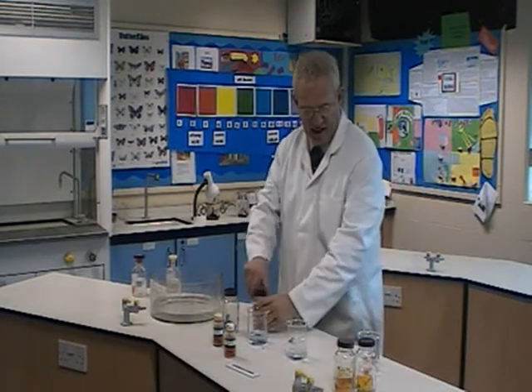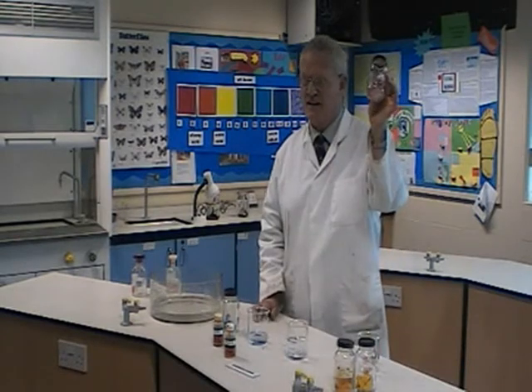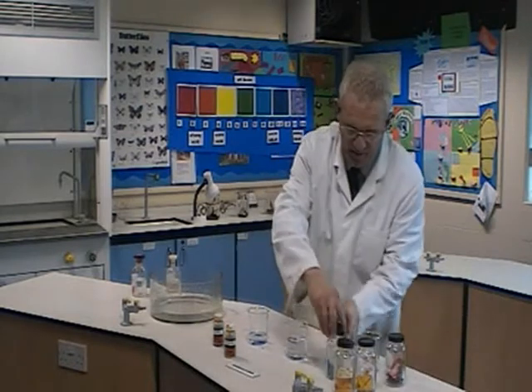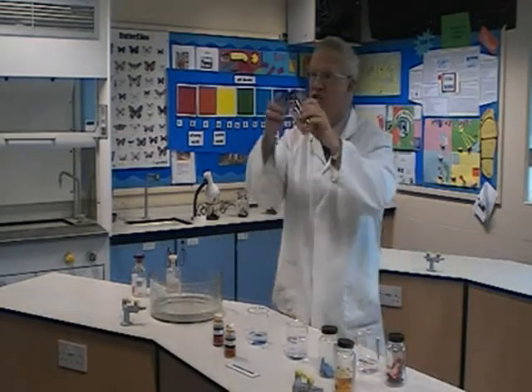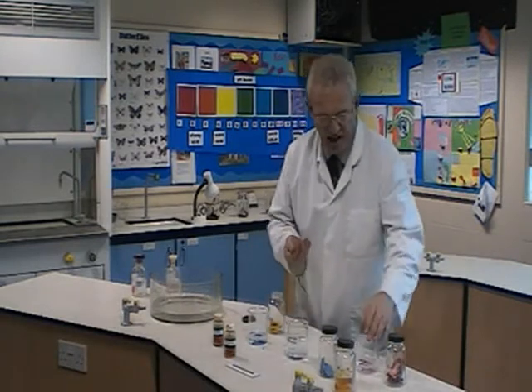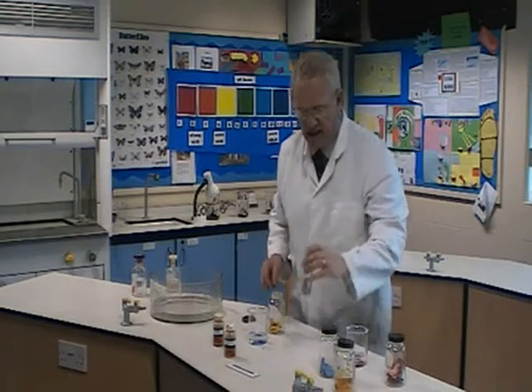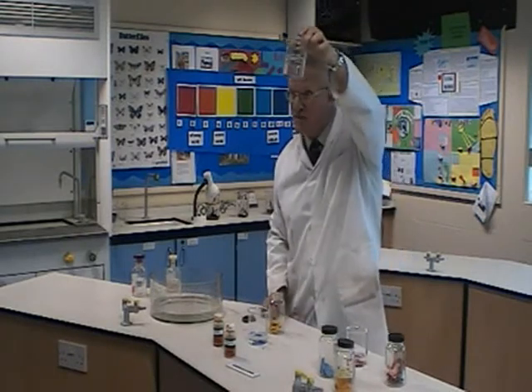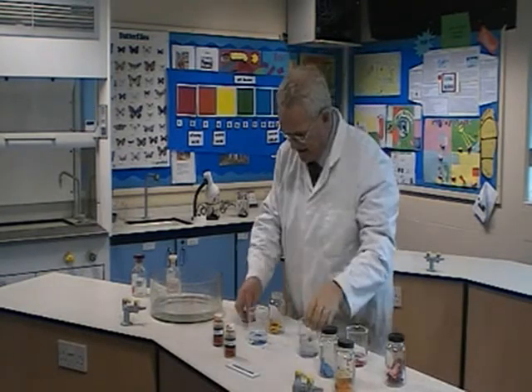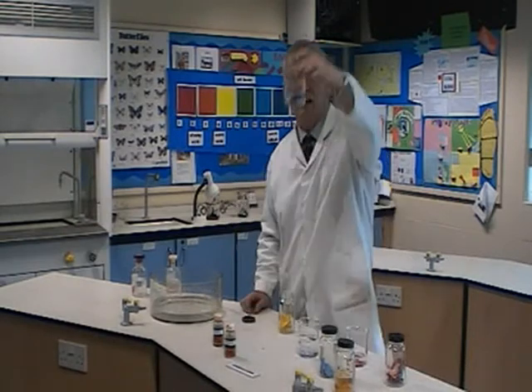A little rhyme coming up — but let's just refer to these as indicators. Although that's litmus paper, let's just refer to indicator paper. I can also use universal indicator paper, which I try to work with most of the time. Chuck it in the acid — a lovely vivid red. Throw it in the water — going green, which is what water is: neutral, green. Chuck it in the alkali — lovely dark blue.